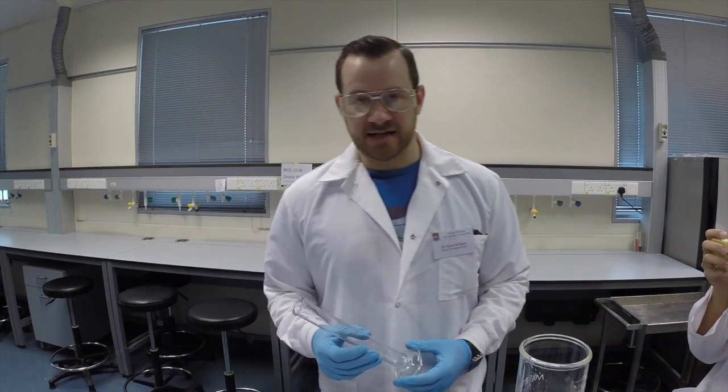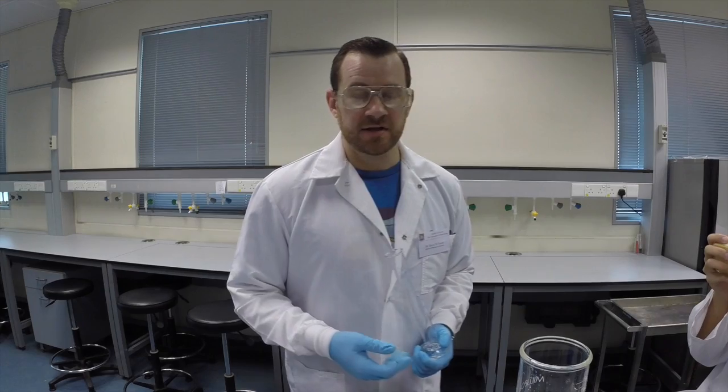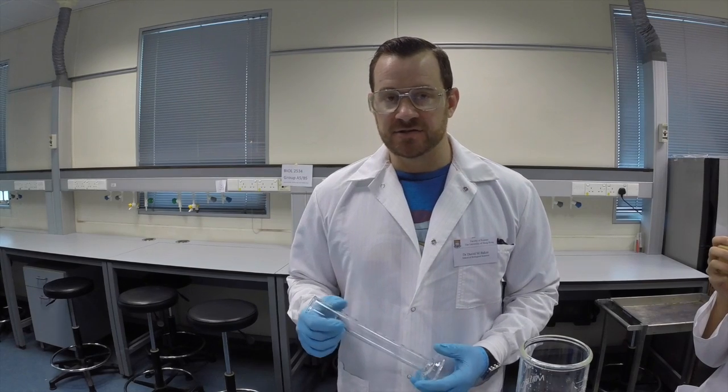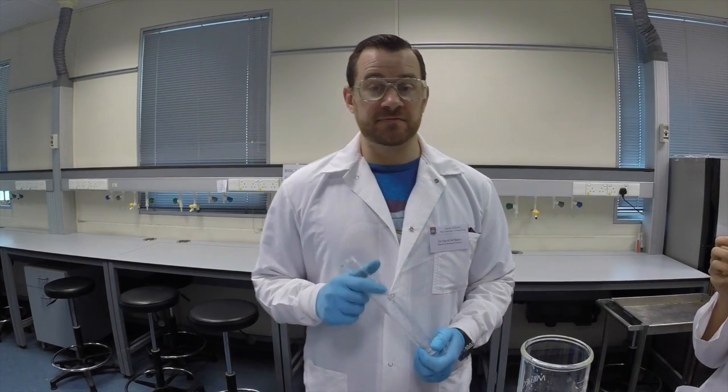Now, the Enterococcus assay will be conducted with various dilutions because we actually don't know what to expect. We don't know how many microbes are there. There could be 0, there could be 20, there could be 12,000 of them per milliliter of seawater. So how do we determine what is the right amount of water to filter?